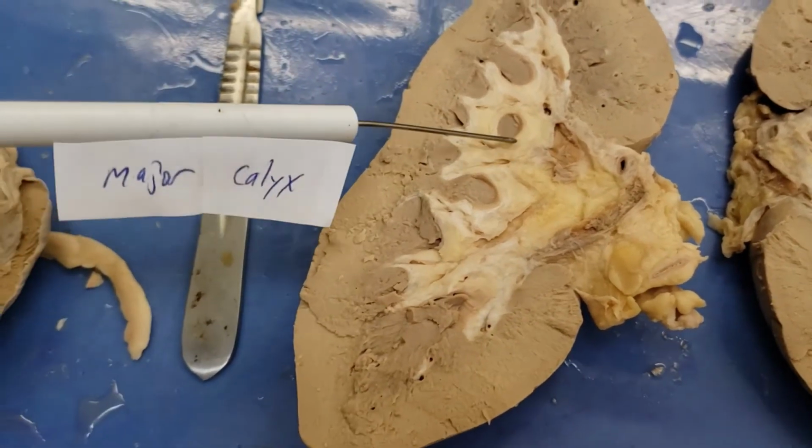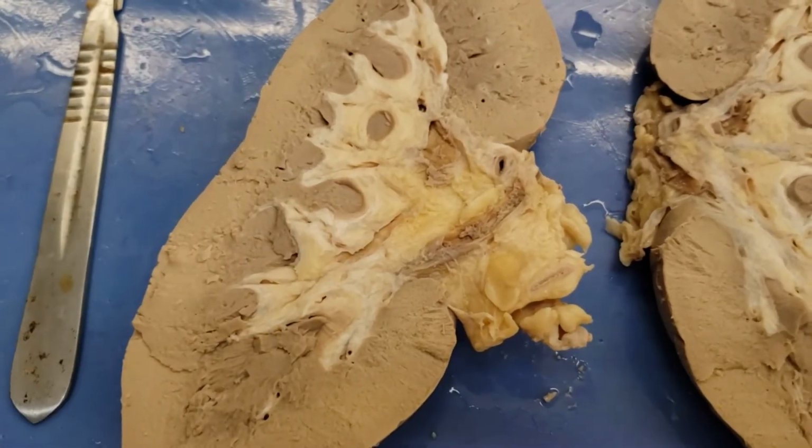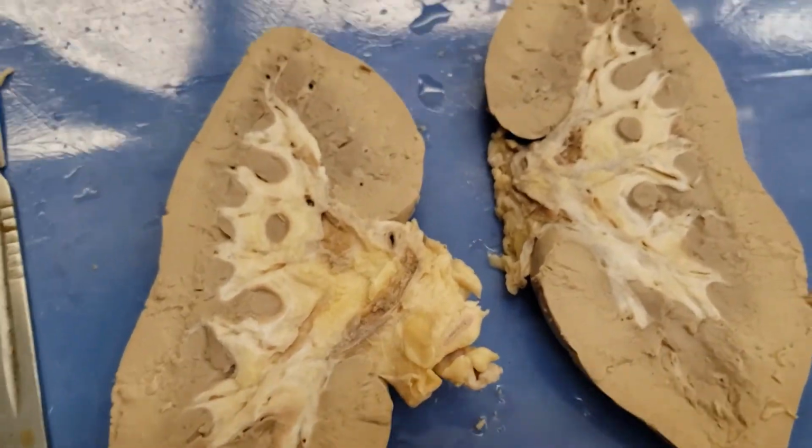They dump in further together and pool up into the pelvis, and then they'll expel the fluid outside the body.